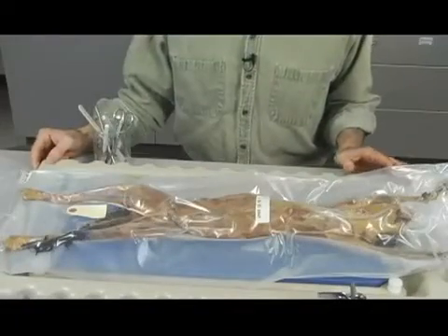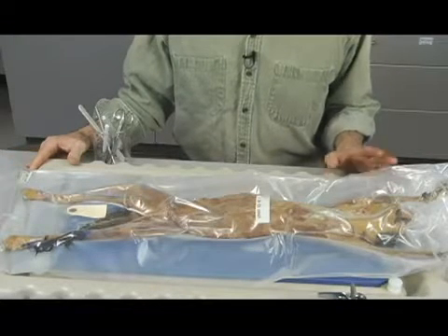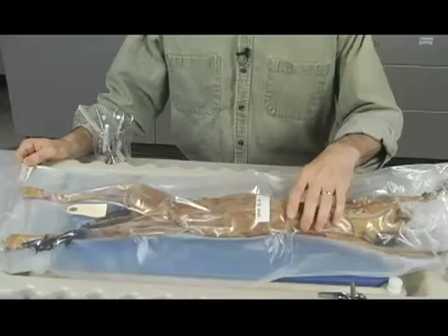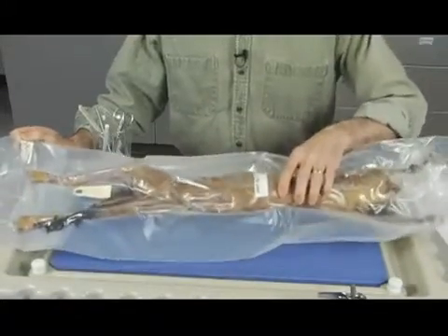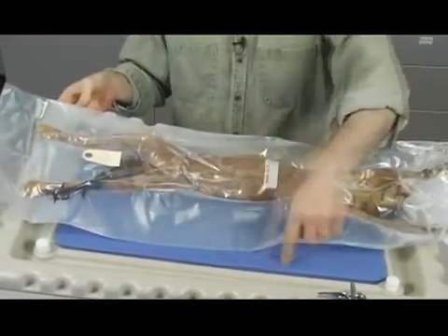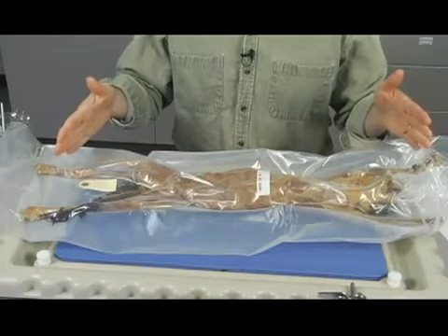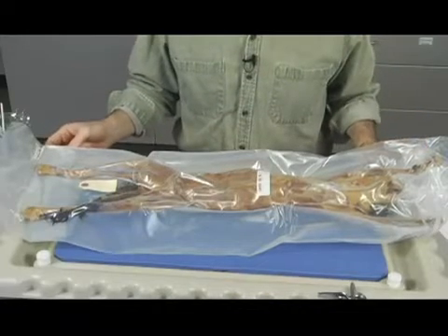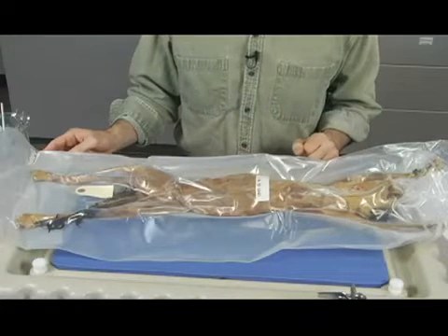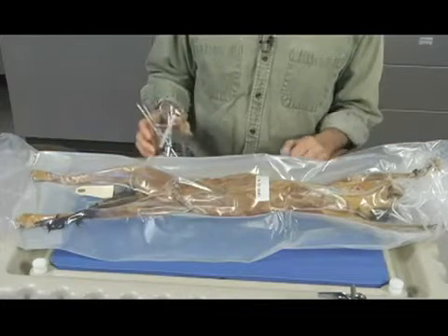All right, this is some of the materials that we're going to be using for the lab, and there's a couple of things that you should be able to see right here. First of all, there's the cat. It's in the plastic bag, and we'll be talking more about that in a second. It's sitting on the tray that you can see here that has a kind of rubber lining on it, and that we'll be using for these specimens. As you can see, although this cat's a little long, it fits pretty well into the tray, and this is something that we'll be depending on to hold the specimen and to catch any fluids and things such as that.